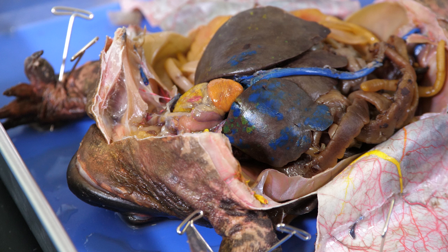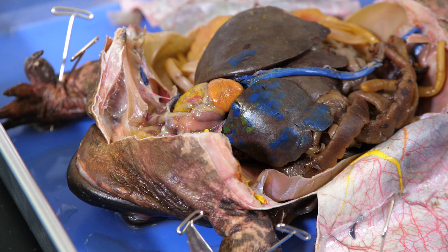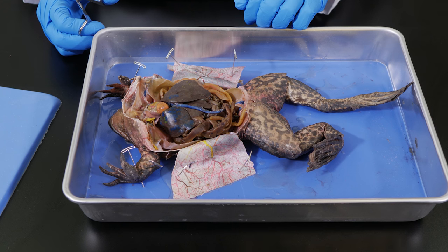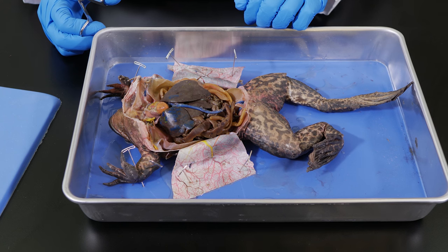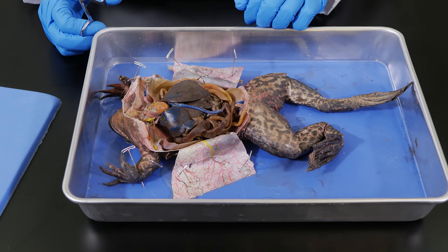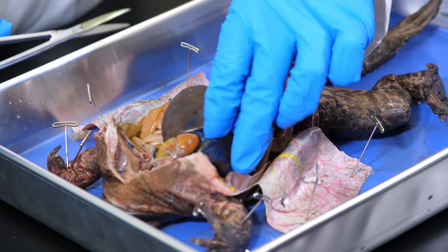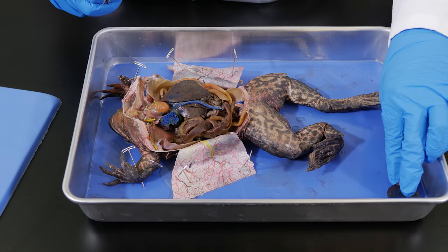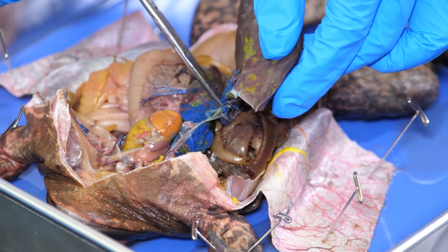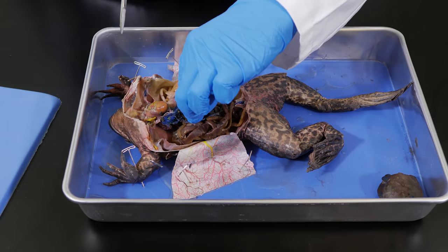In order to see some of the other major arteries and veins, we need to remove the liver and some of the organs of the digestive system. We want to be very careful not to damage the heart or any of the blood vessels beneath the liver. All three lobes of the liver join in the middle, so we will cut away the lobes, starting with the right lobe, the left posterior lobe, and finally the left anterior lobe.